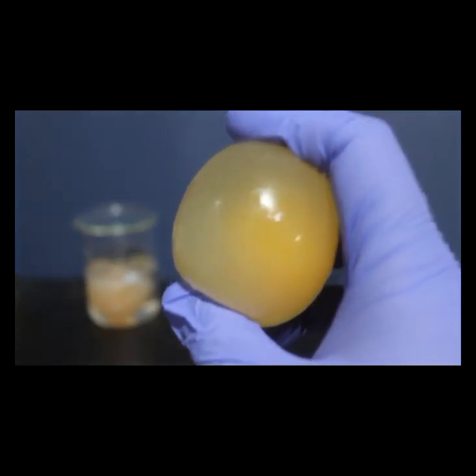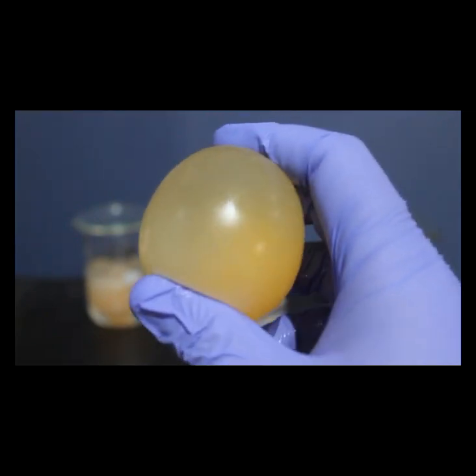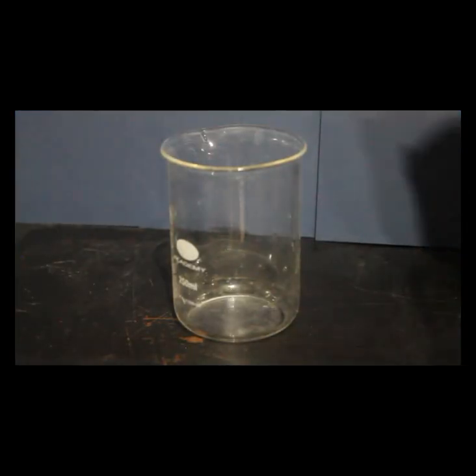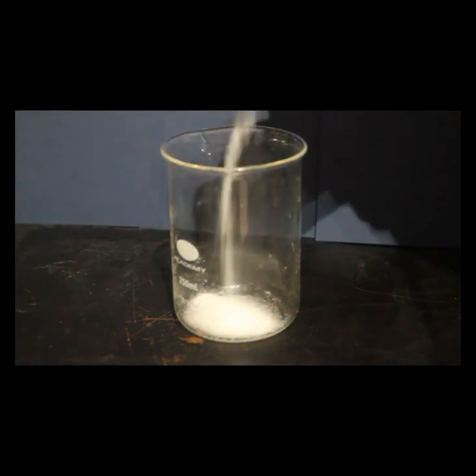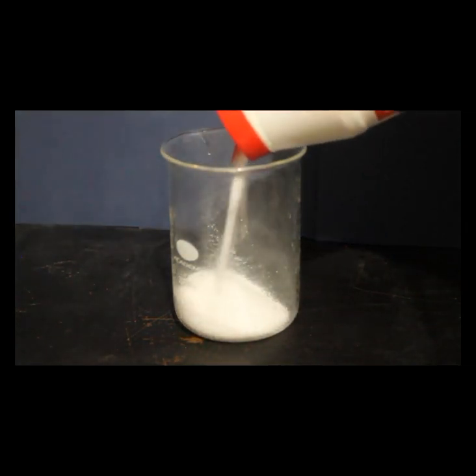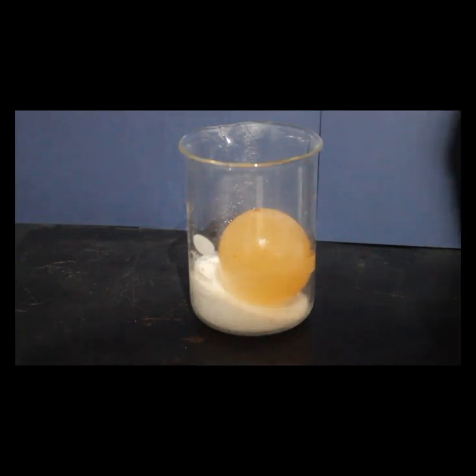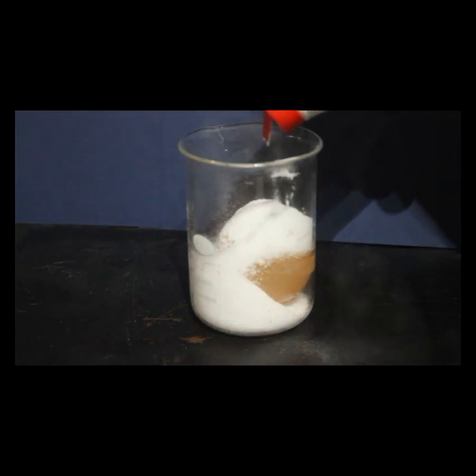We will be putting these eggs under 3 different stresses, which certain microorganisms have evolved to resist. The first stress that we'll be putting an egg under is high salinity, or a high concentration of salt. So for this, we will fill the bottom of a beaker with table salt. Place our shellless egg on top of the salt, and then bury the egg in table salt.